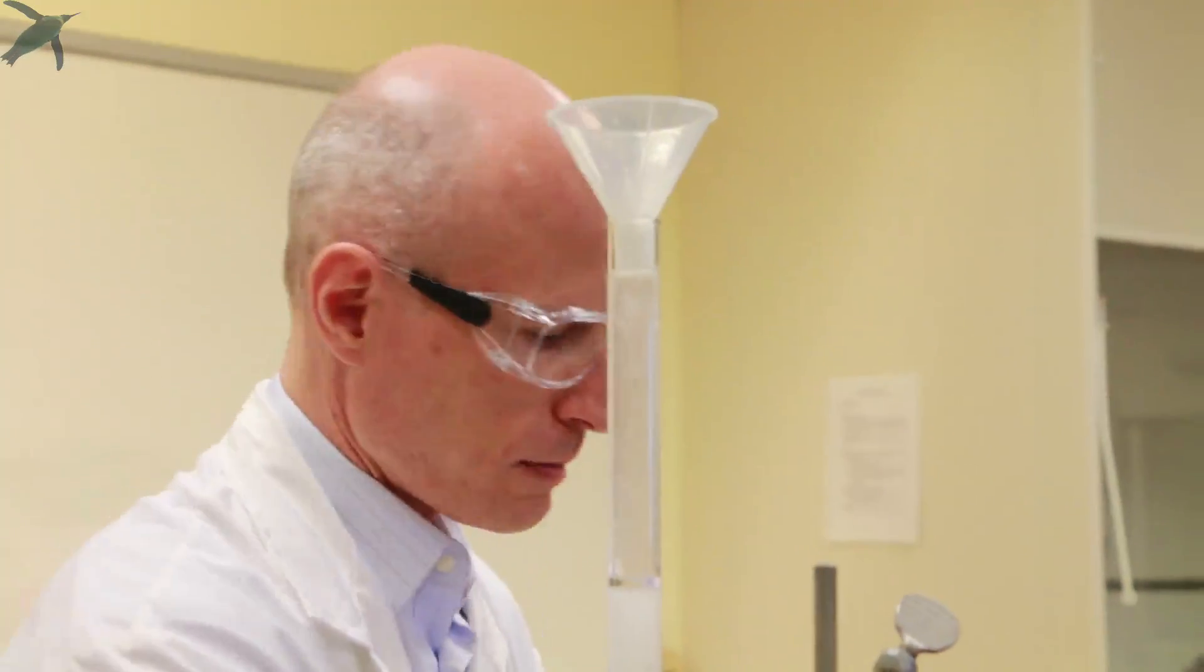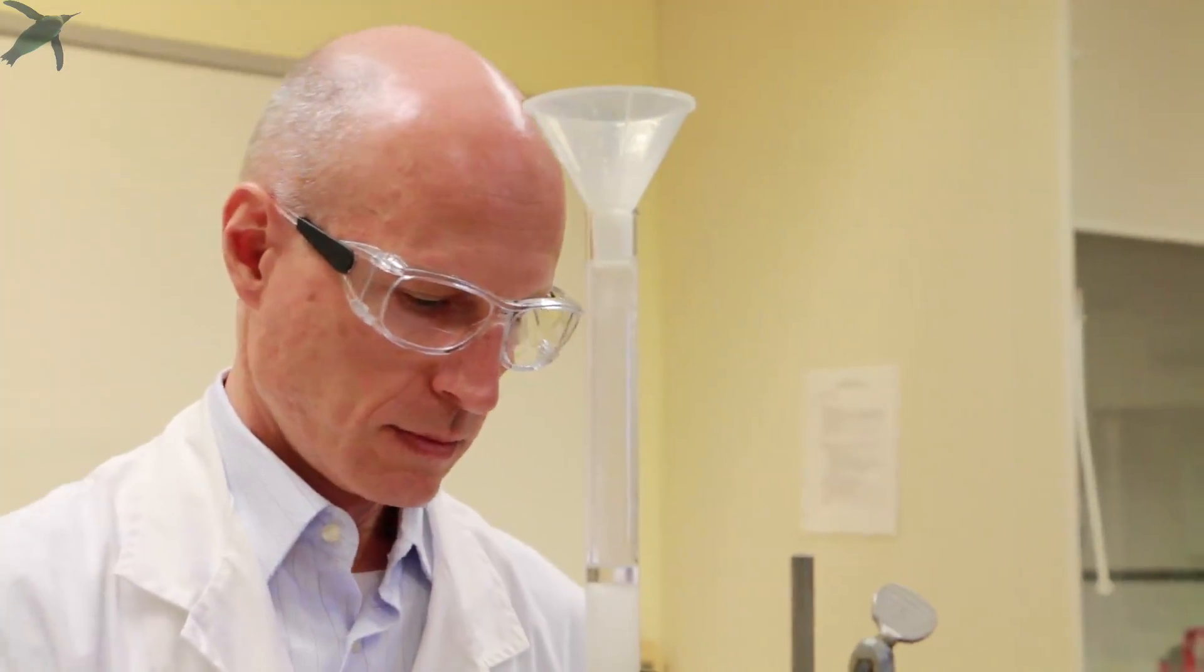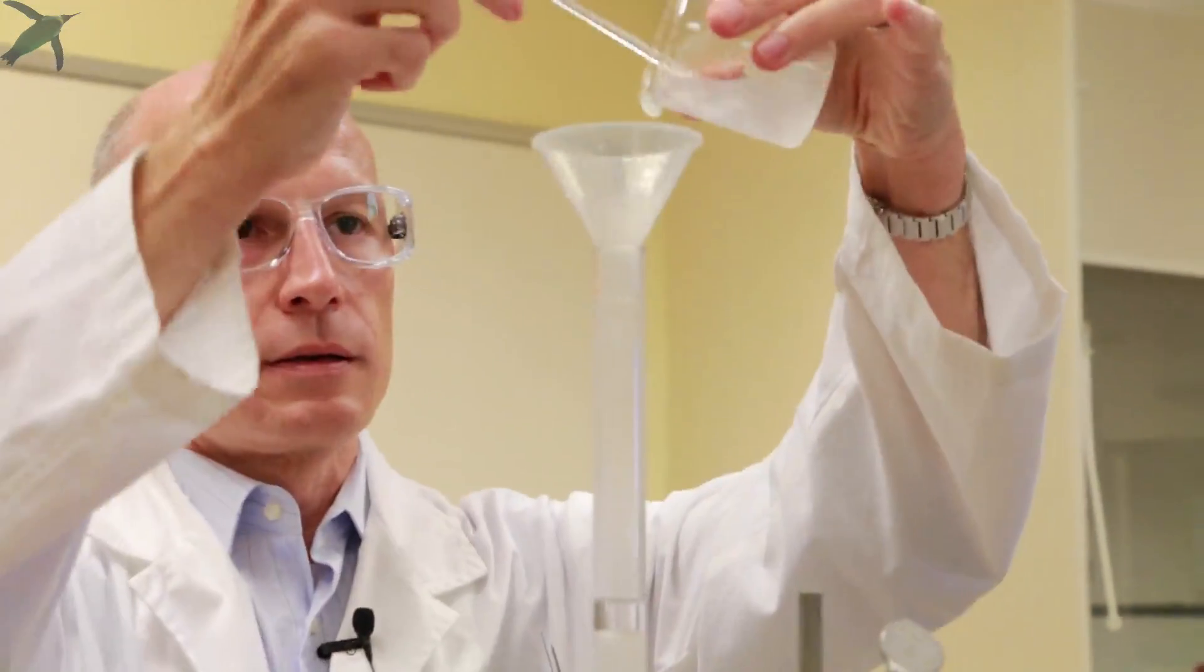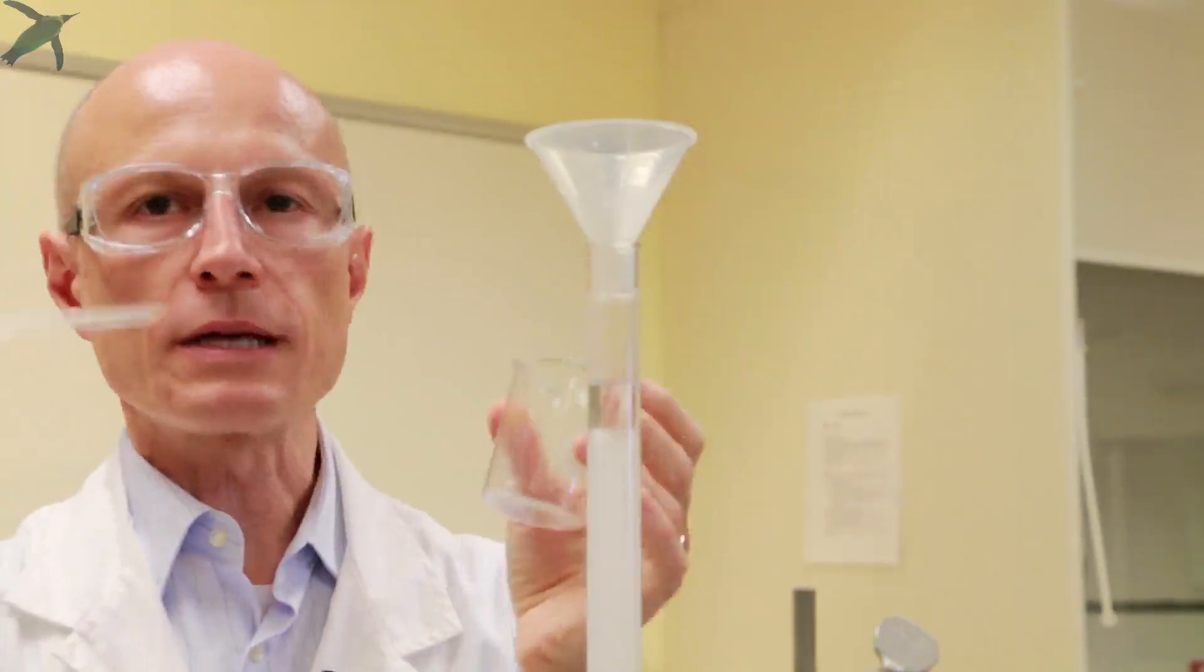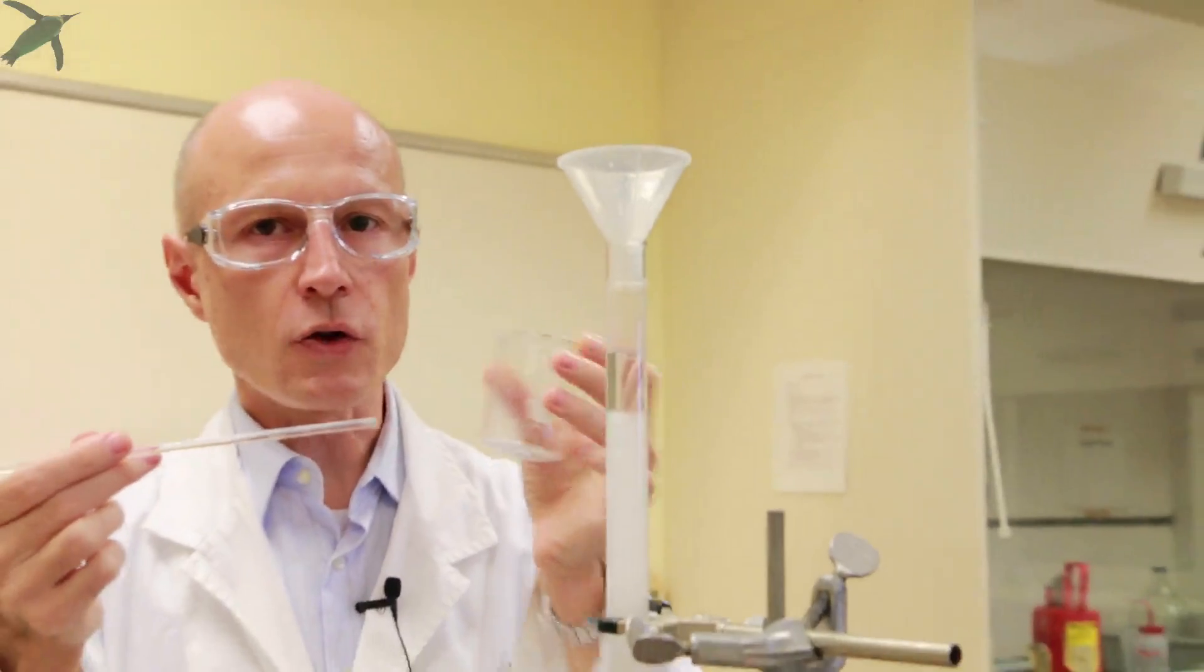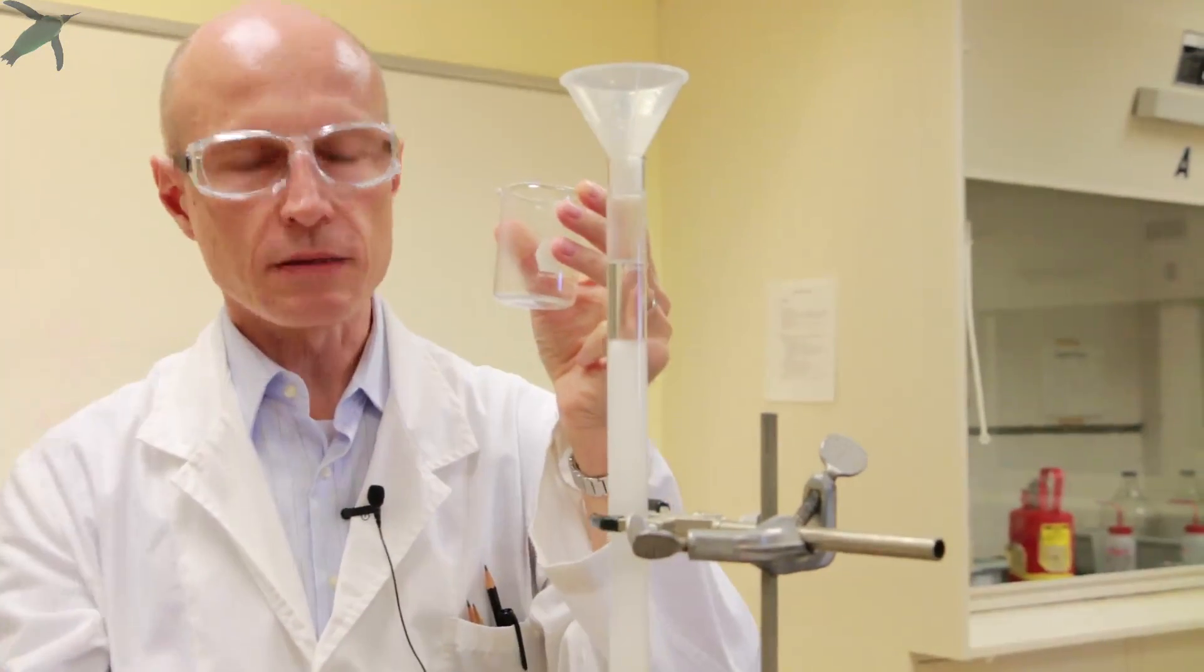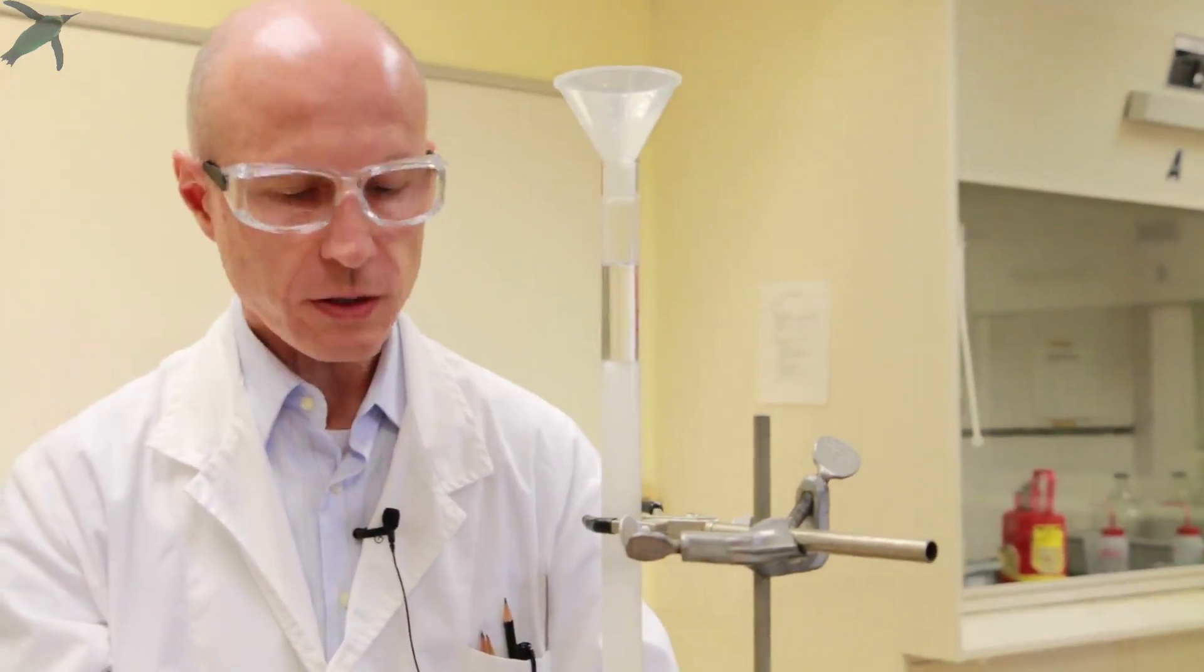And then you can add some more solvent to rinse the beaker. And it's not important that not all the silica gel is going into the column. This is totally inconsequential.